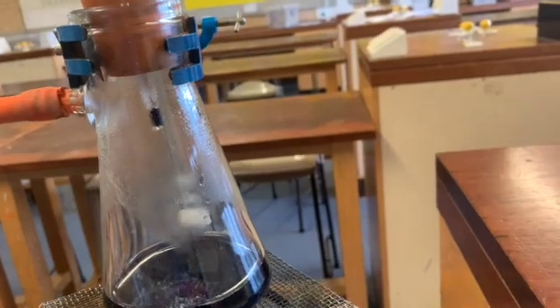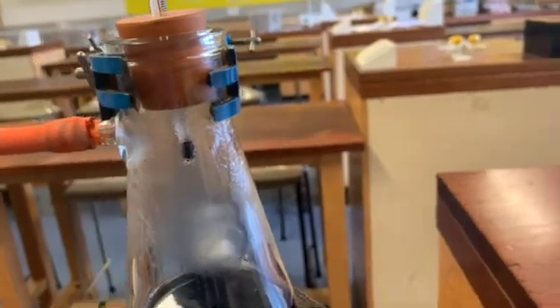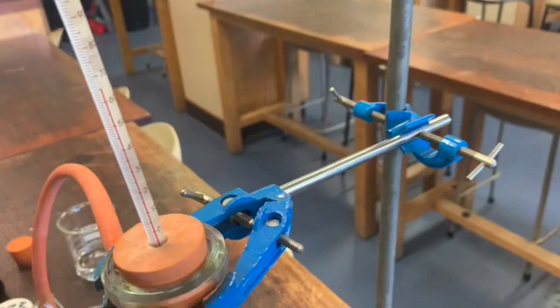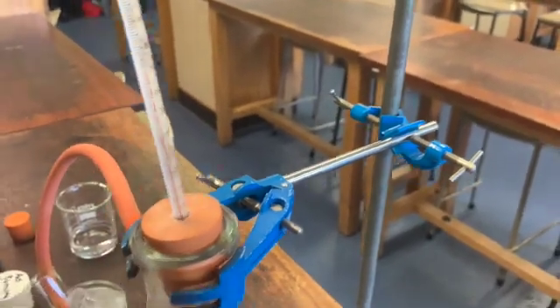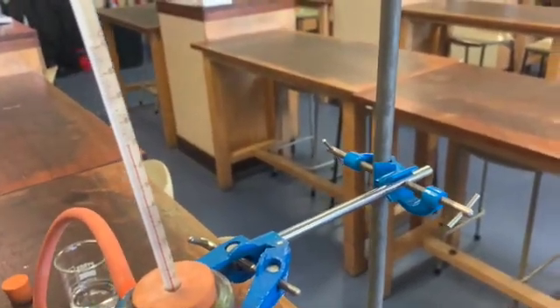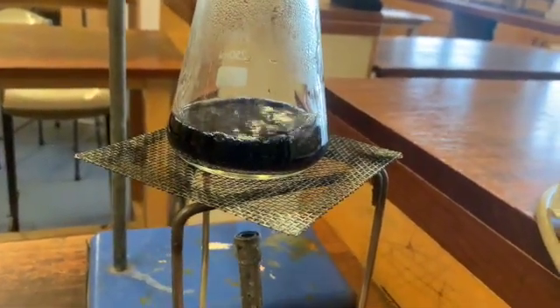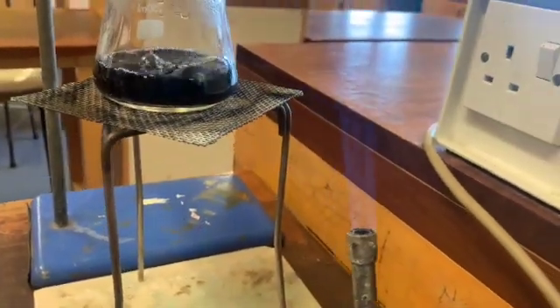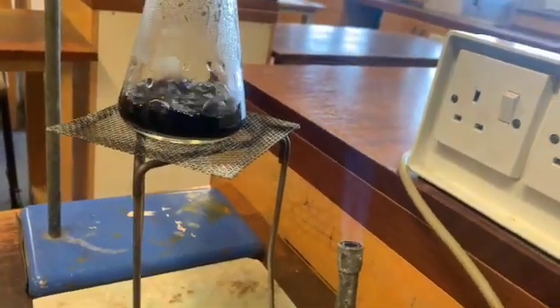You can see here I've got a little bit of condensation on the side of the flask and that means it's almost ready. If we check over here on my thermometer, it's getting quite high. We've got to about 65 degrees and rising, which means the vapors are starting to form - so that's really good. When this gets to 100, we know we're getting pure water coming out. There's a little bit of bubbling happening now but it's not quite on the boil. I think it's just about to boil though, so I'm going to take off the heat a little bit and let it calm down.